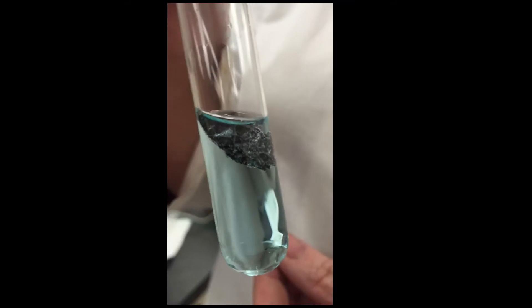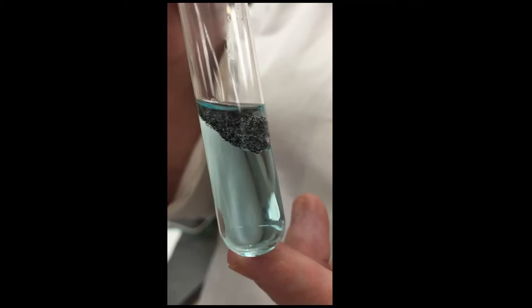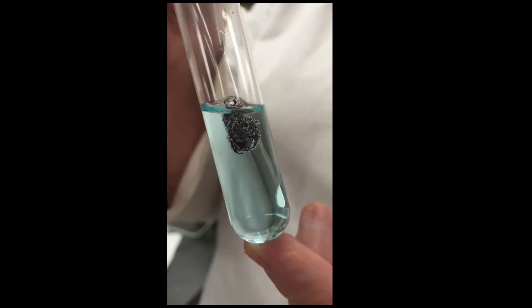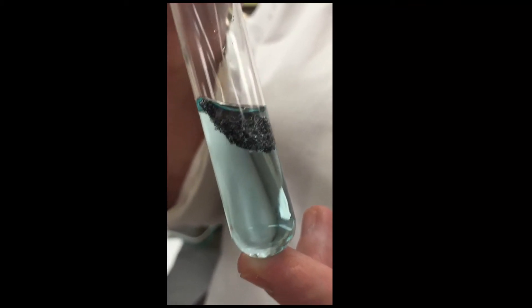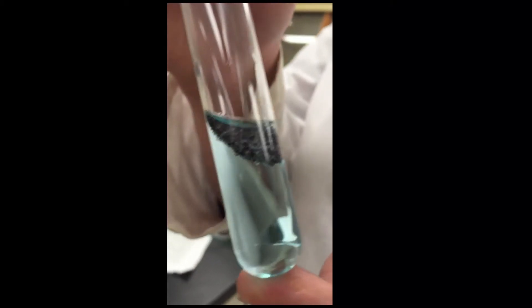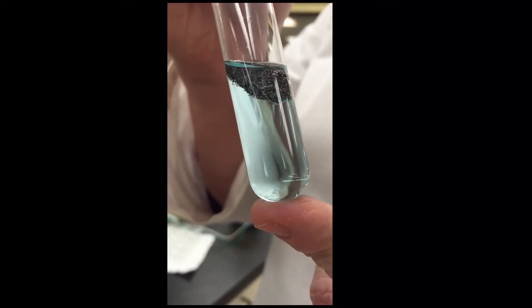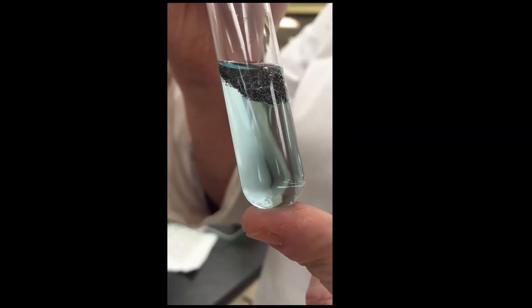I'm not sure if you can see it with the angle, but it's becoming darker colored. The bubbling is a secondary reaction occurring between the aluminum and some leftover acid that was in from the previous reaction.